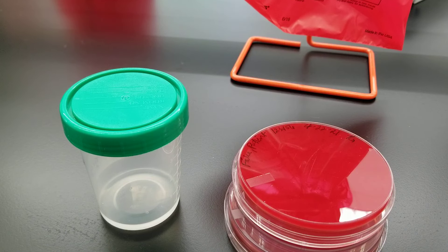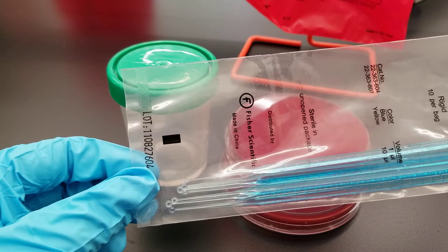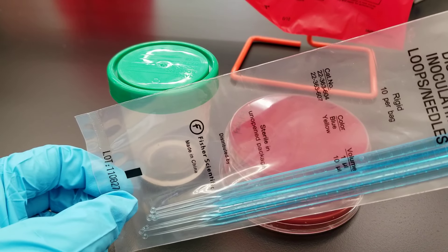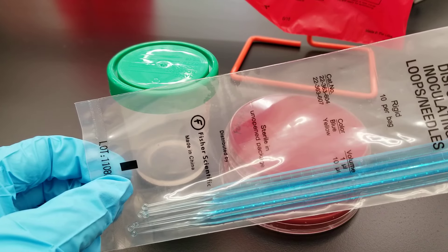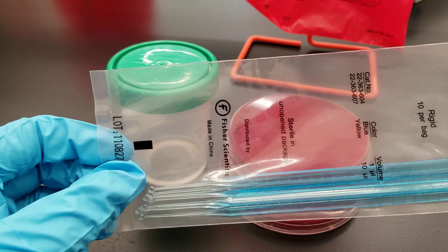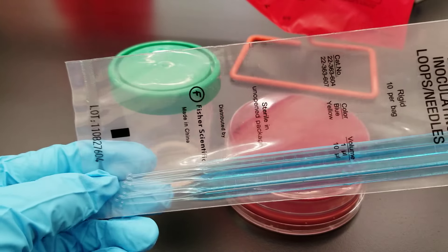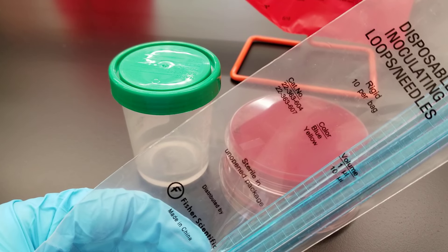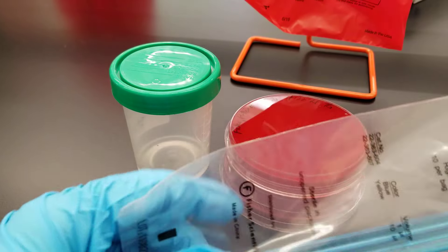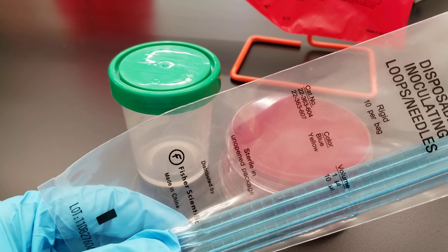That depends on a whole lot of factors, including how many colony forming units there are. When we inoculate a urine culture, we'll be using a different loop than we're used to seeing. Yellow loops are 10 microliter volume, whereas a blue loop is a one microliter volume. When we count colony forming units, we take into account the dilution factor of the specimen and how much we actually introduced onto the plate. Noting that the blue loop, which is what we're using, is a one microliter volume, we will multiply however many colonies form on the blood agar plate by 1,000 to figure out how many bacterial cells are within a one milliliter volume.